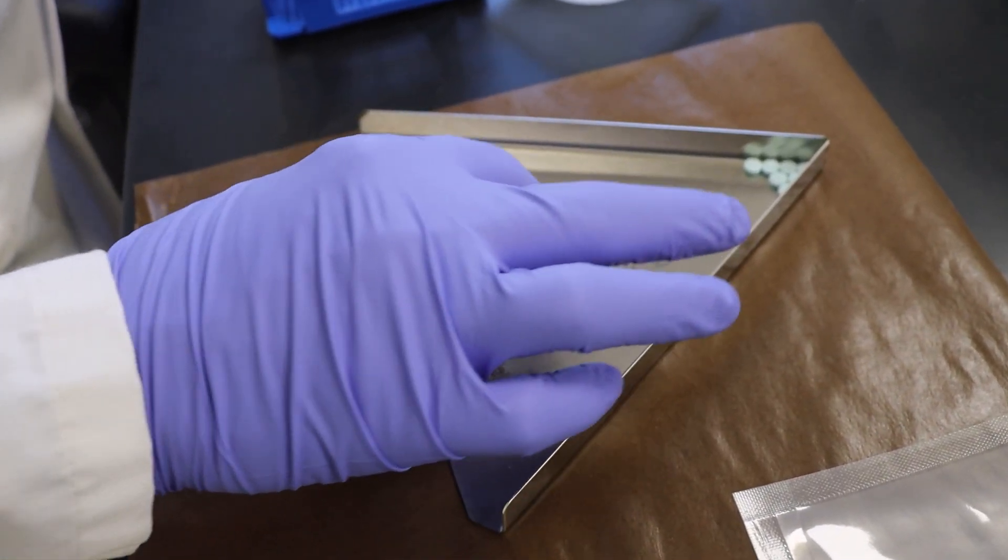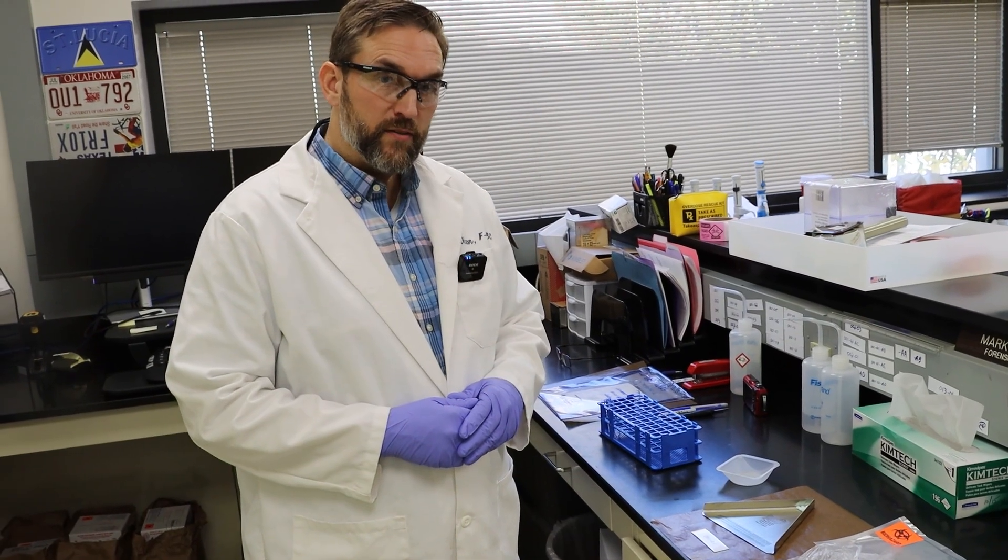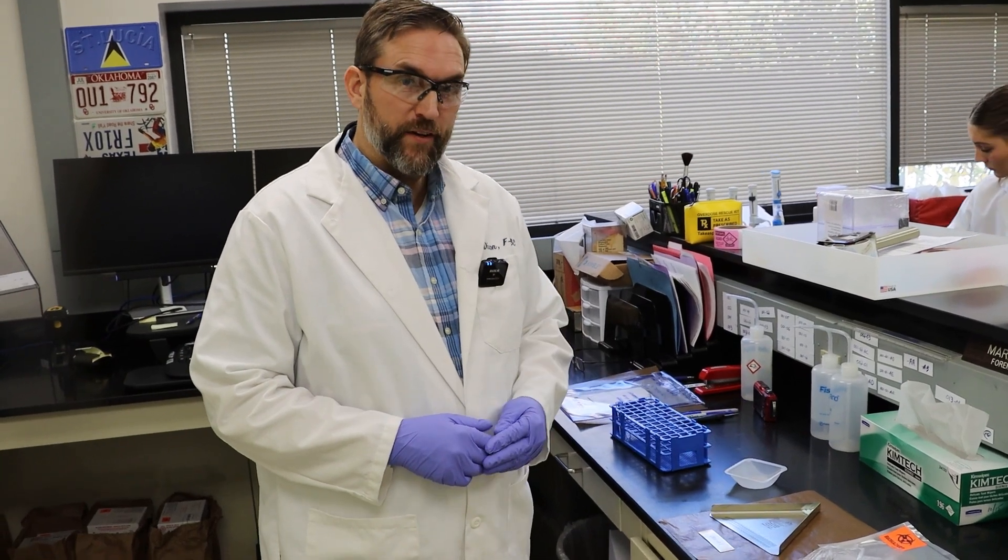We're going to get a count on these. We have a triangular counting tray that they use in pharmacies, and it will help us get a count. This one's easy. We have nine.